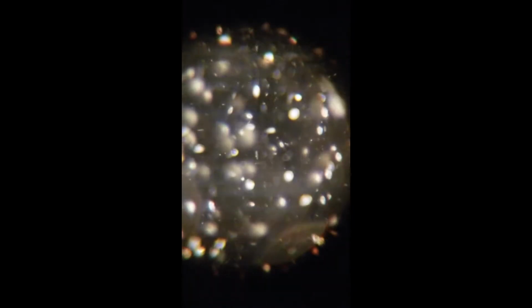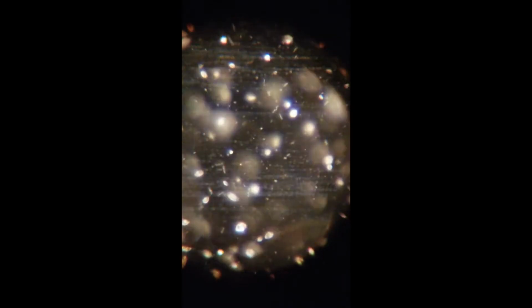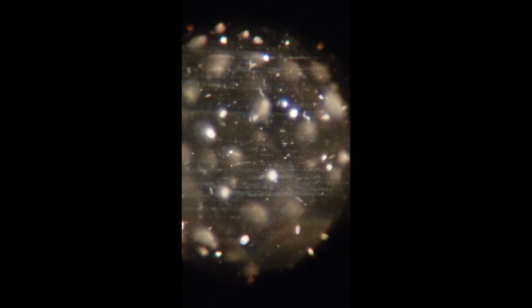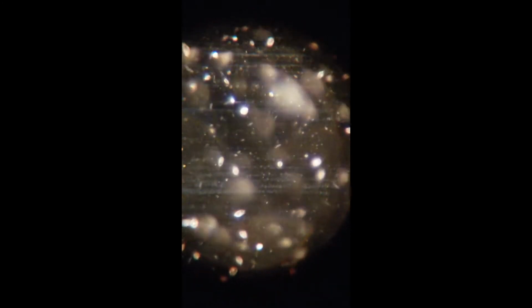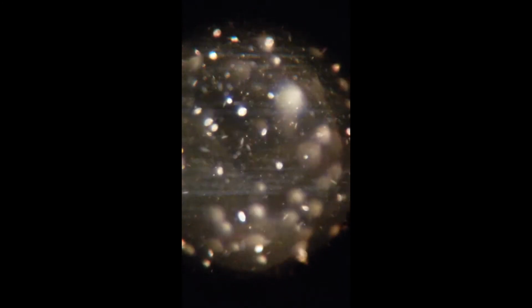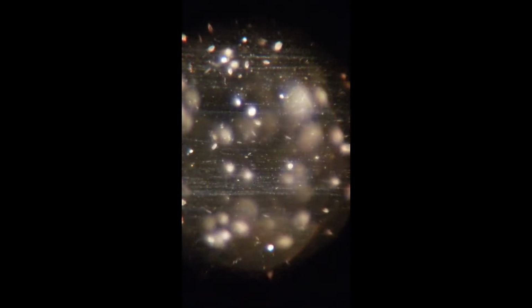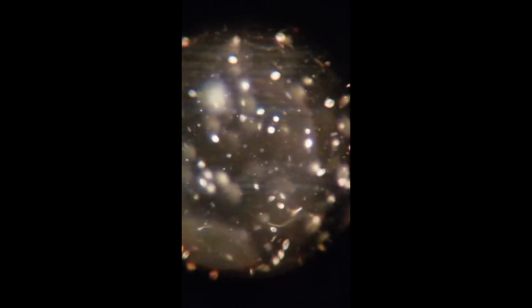And if we go in even further, we can see not only the ciliates, but spiral-shaped bacteria. They move by turning in a spiral. Isn't that weird? Can you see them? They're a little bit smaller than the ciliates, but there sure are a lot.